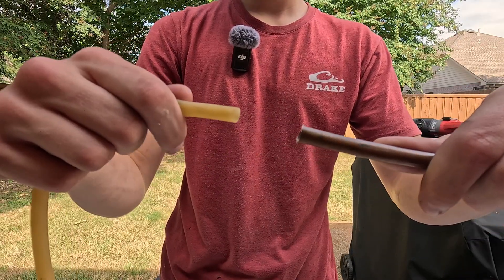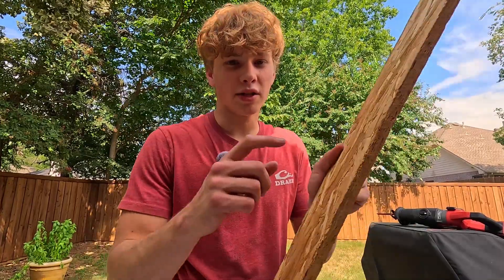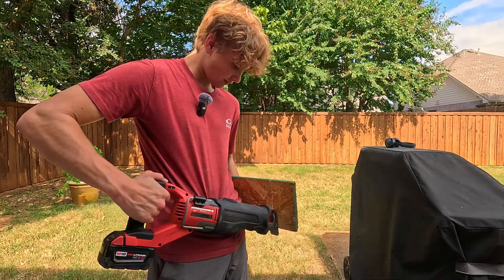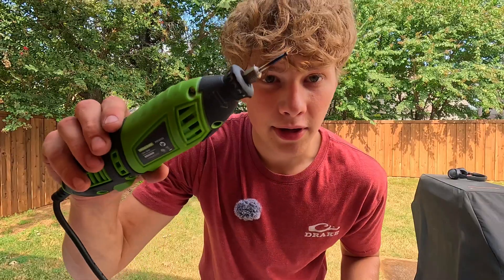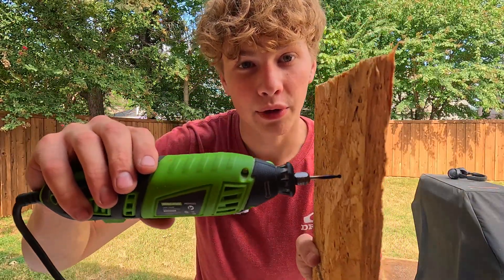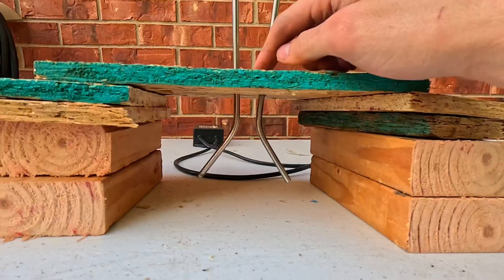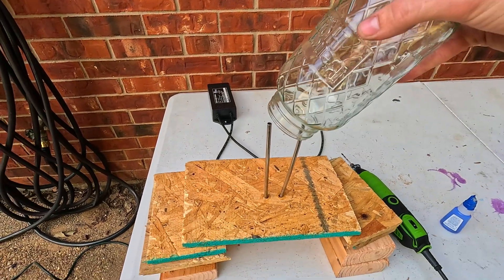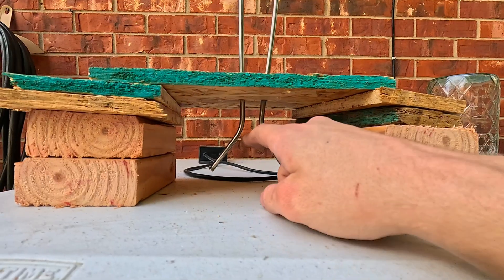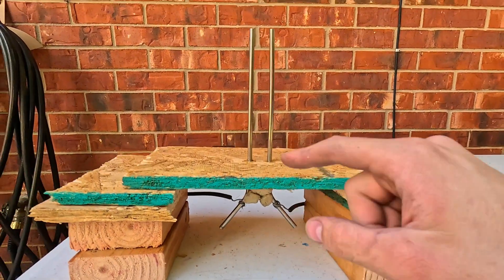Instead of the metal straw, you could swap it out for some copper tubing, but since it is considerably larger, it is harder to fit the tubing on — obviously this is too big, so we're going to cut it down. I'm going to use these pieces of plywood as a way to raise our project, and use a dremel tool to drill holes in the plywood to fit our straws. We've drilled the two holes and used super glue to seal it in the top. We can just put our mason jar over it, and we still need to put some plumber's putty in between, so we've sealed it and connected our wires.